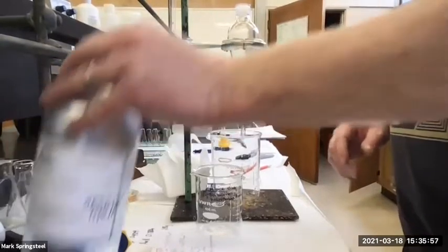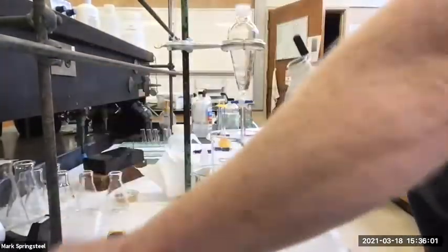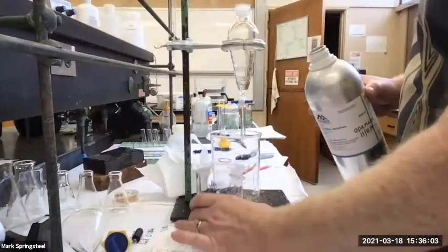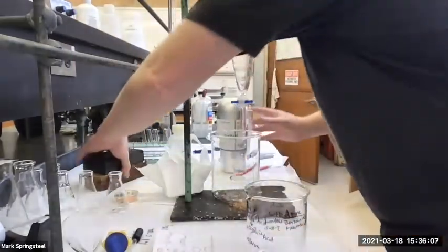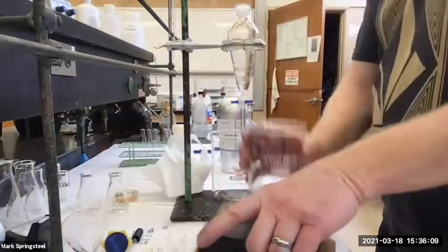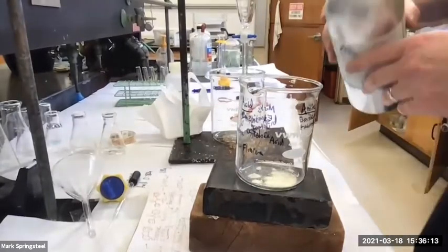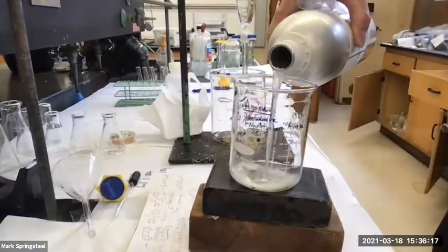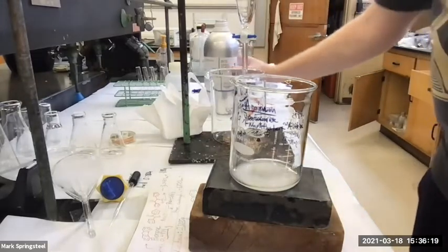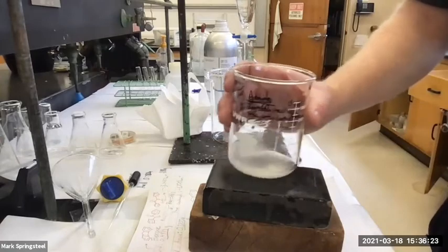Okay, and now let's start adding some diethyl ether. All you really need to do is just pour some in, roll it around, and see how it goes. So here, I'll set up a stand for this beaker. See what you guys think. I've got my graduations on the side. I'm going to aim for about 20 milliliters or so. Okay, so far I probably added about 10 milliliters. And it's looking pretty good.